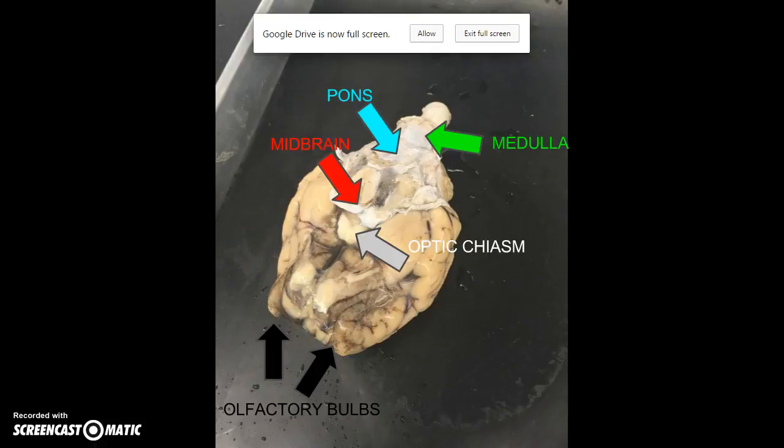Now we have flipped the brain over and you can see the ventral view. You can identify the medulla, a part of the brain stem, in the top right of the picture. The midbrain, which is the portion between the pons and the diencephalon, and the optic chiasma, which is the crossing point of optic nerves in the center of the brain, and the olfactory bulb, which is a neural structure involved in the sense of smell in the anterior of the brain.